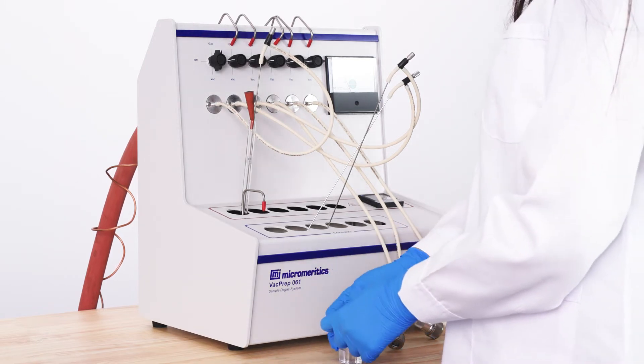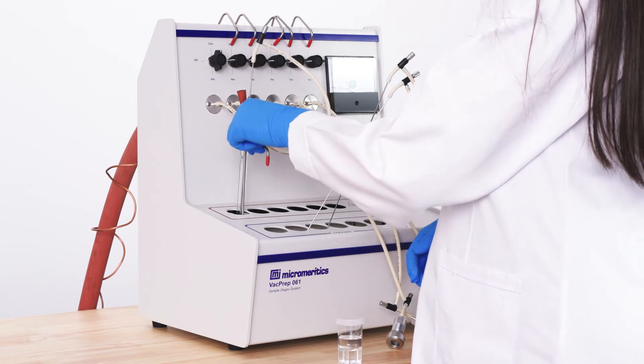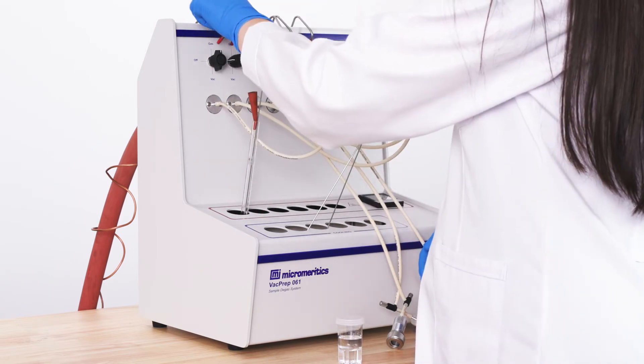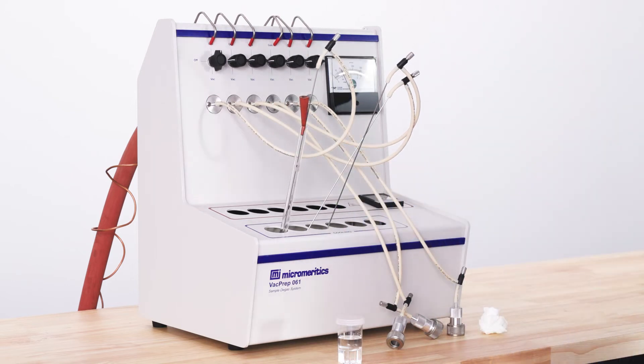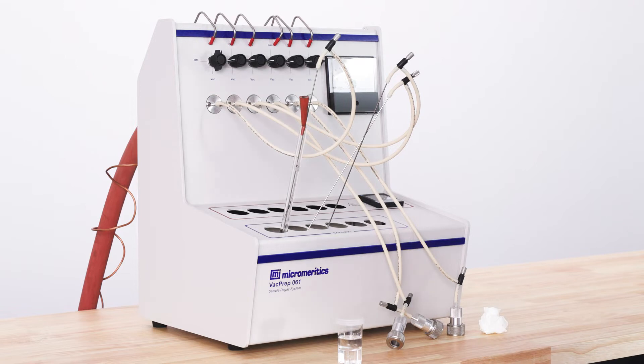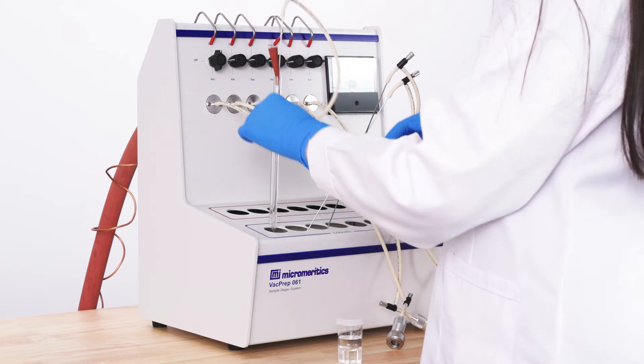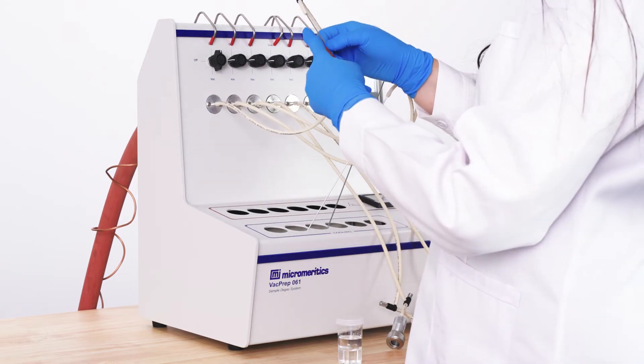Once degas time is complete, move the sample to the cooling station. Once cooled, your sample is ready to be weighed and mounted on your instrument.